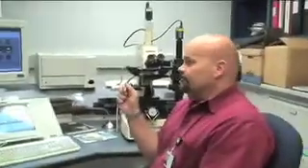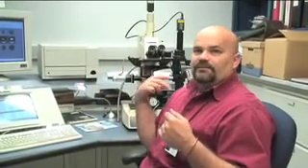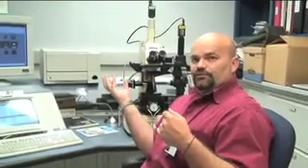What we need is right down here — all the lands and grooves are nice and intact. It's an Integrated Ballistic Identification System. This is a system used within the states and other countries around the world. It is designed to capture digital images using a laser beam to scan all the individual characteristics that we use for identification into a backup database, which can be retrieved at a later stage to be compared to physical evidence captured from or retrieved from a crime scene.